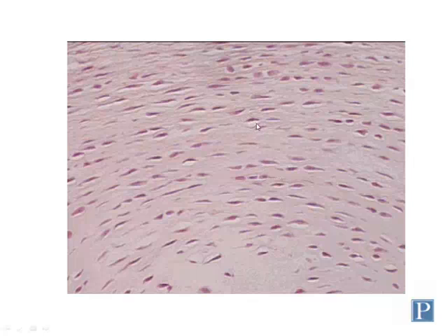Fibrocartilage does have a solid matrix, so these cells are found within lacunae, and you can see the lacunae surrounding these chondrocytes quite well in both of these slides. So if you see those, you know you're looking at fibrocartilage, not dense connective tissue.